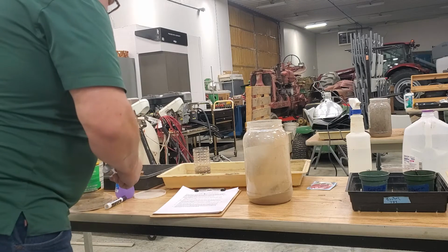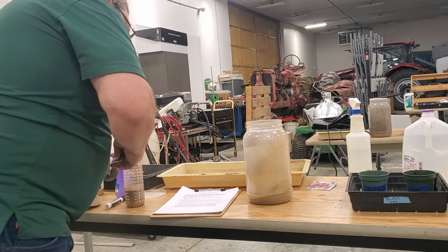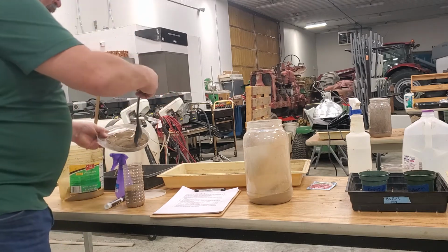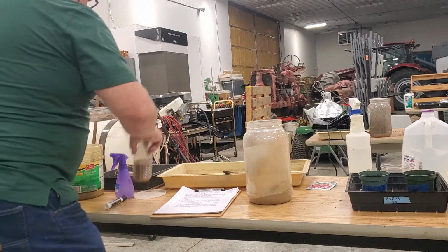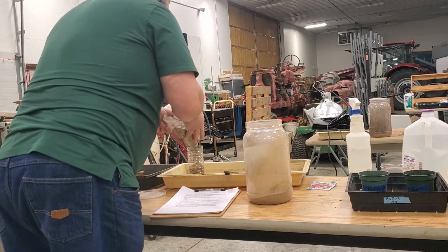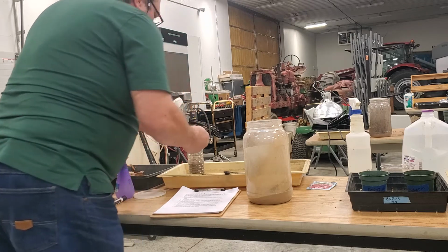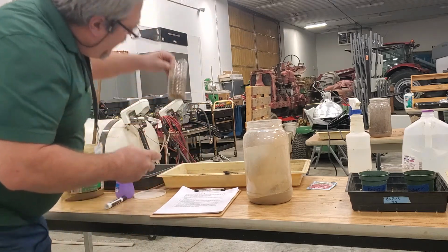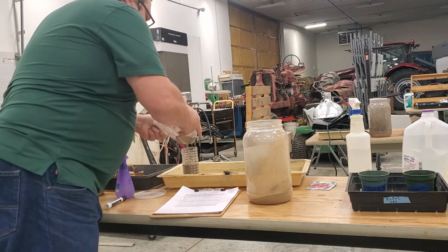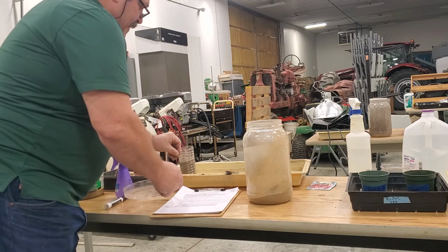And then it says mix a small amount of food, grass clippings and leaves, and then you fill that a fourth of the way at the top. So I'm going to cheat here a little bit, just pour it in there. Kind of hard for you to see, but I can see there's a definite difference between the top soil and the bottom soil.